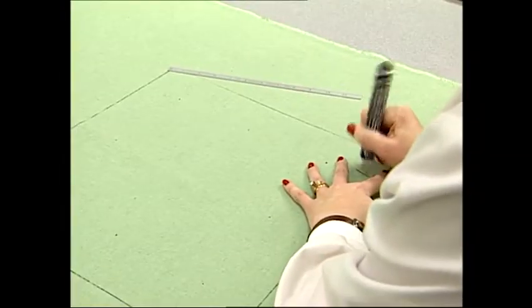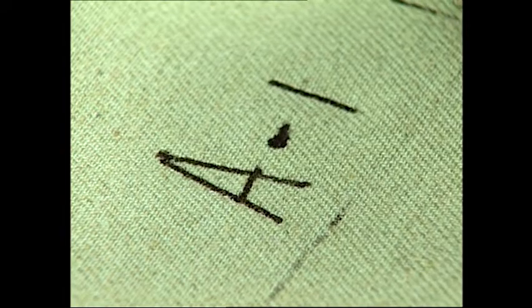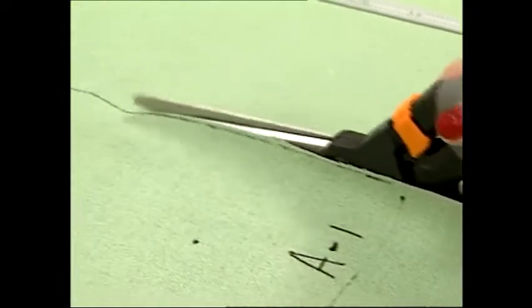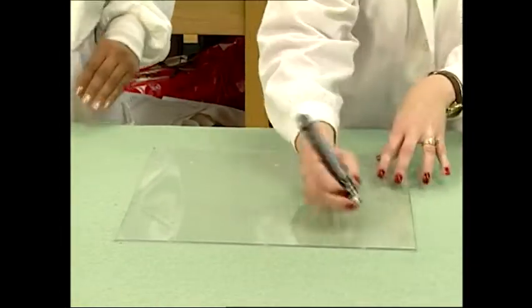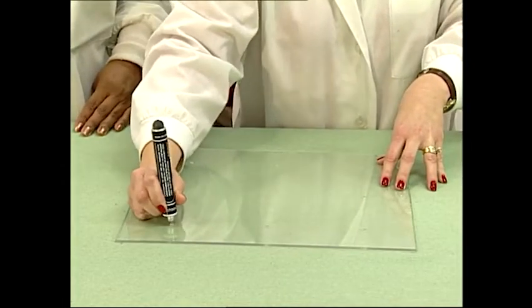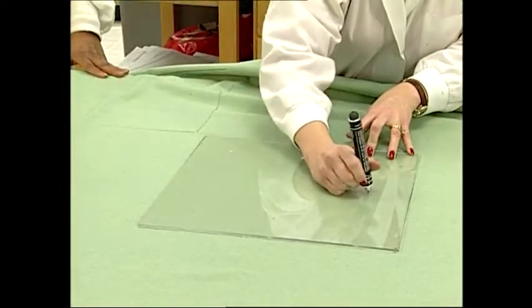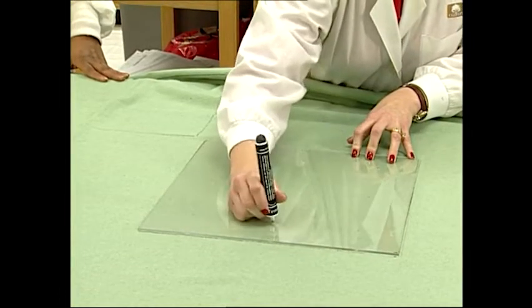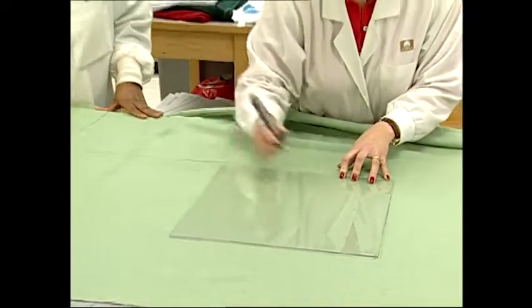Label each specimen with proper identification so it is always read in the length direction. The identification can be a combination of numbers, letters, and symbols. Carefully cut out the specimens to prevent distortion. Mark each specimen with three sets of length benchmarks and three sets of width benchmarks using a ruler, a stamp, or other suitable device. Make sure the ink used is indelible to laundering. Normally 10-inch benchmarks are used as they make the mathematics easier to calculate. Some tests call for larger benchmarks, which require the specimen to be larger than 15 inches square.